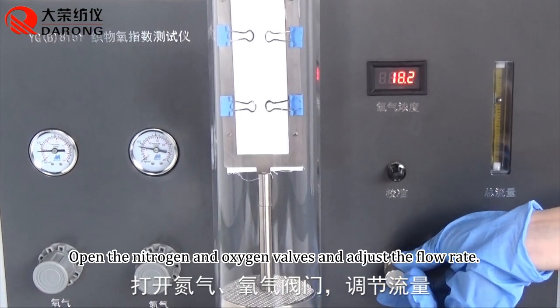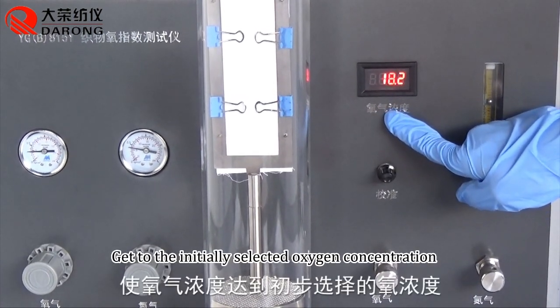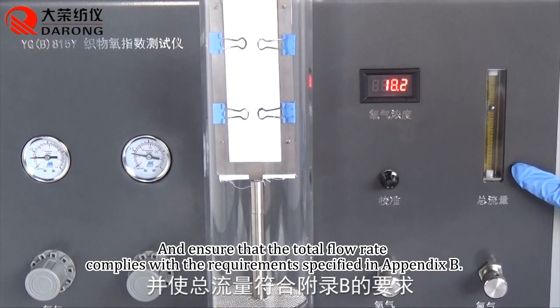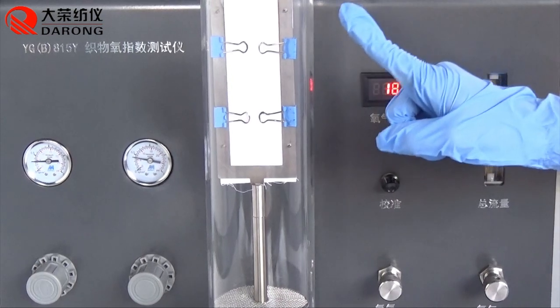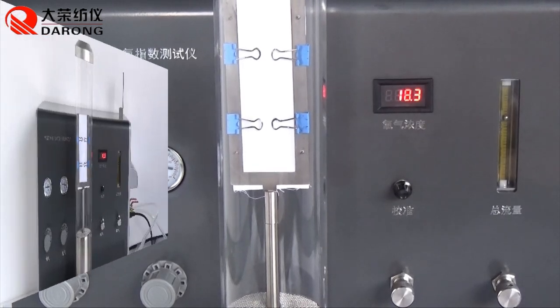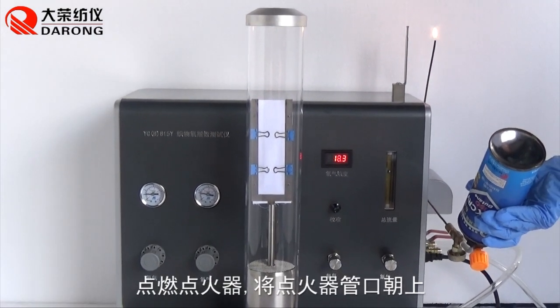Open the nitrogen and oxygen valves and adjust the flow rate to get to the initially selected oxygen concentration, and ensure that the total flow rate complies with the requirements specified in Appendix B. Allow the airflow to rinse the combustion chamber for at least 30 seconds. Confirmation of the initial oxygen concentration.